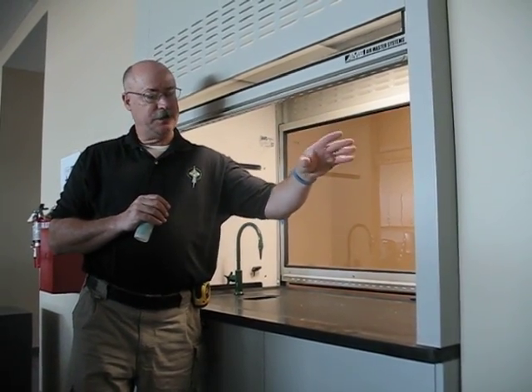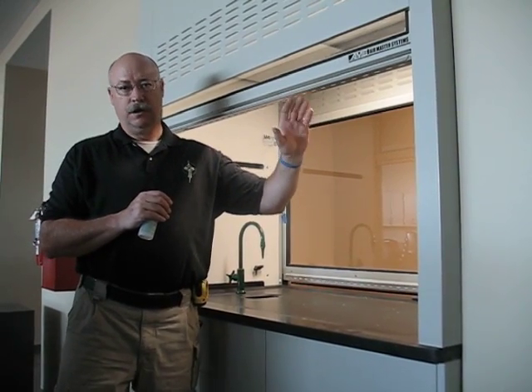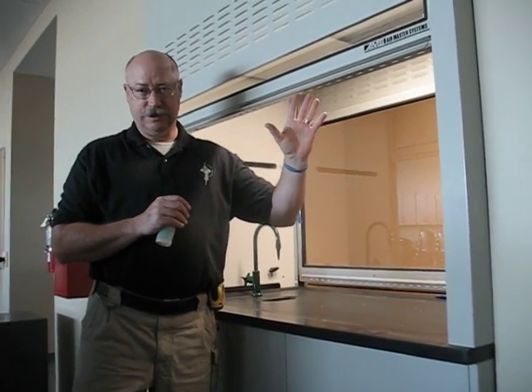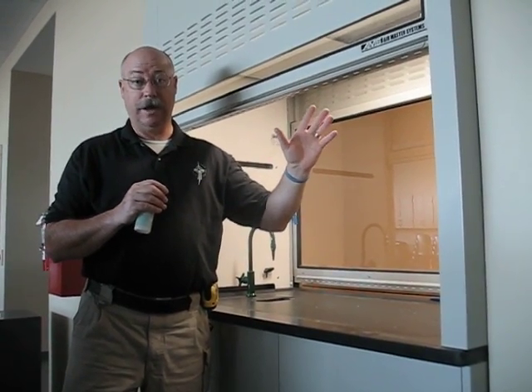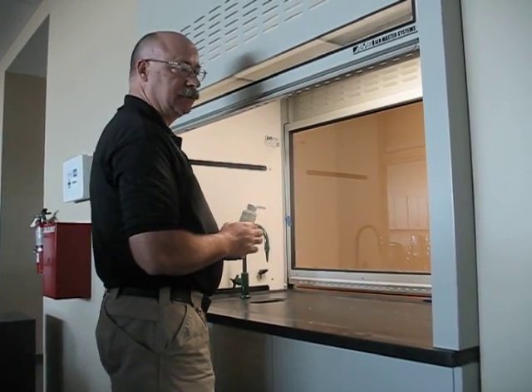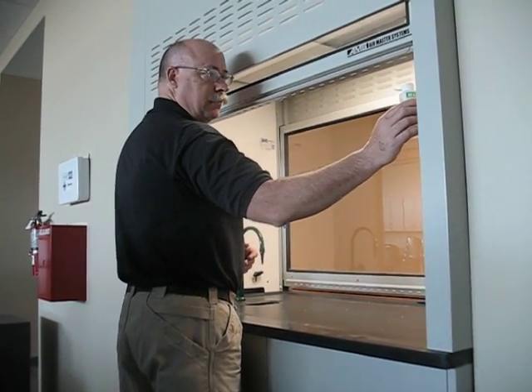We've looked at the engineering aspects of the fume hood. We've measured the face velocity, even though we recognize that there's no correlation between mean face velocity and capture efficiency. So now we're going to actually take a look at how well the hood captures a fume. We're going to be using the standard ventilation fume. It's titanium tetrachloride. I'm going to begin by tracing the face of the hood.